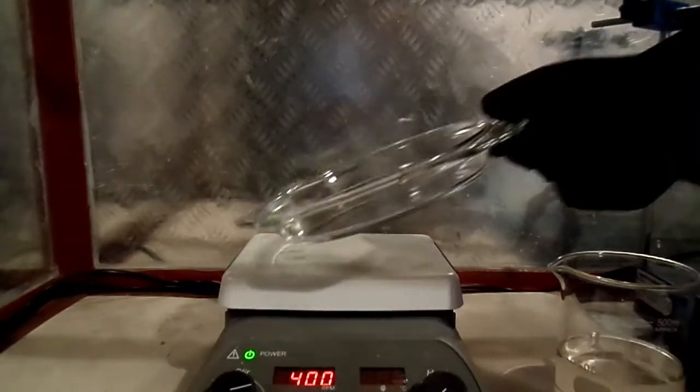After forming the salt, we now proceed to evaporating the solution to isolate the crystalline product.